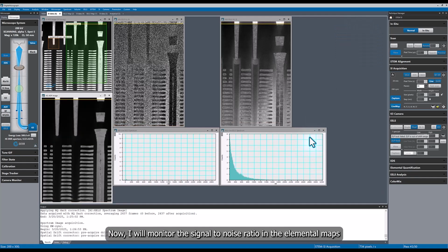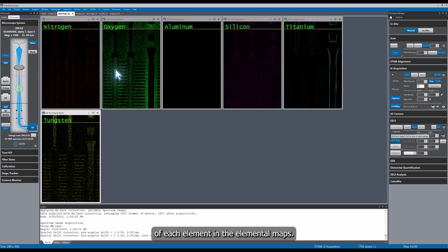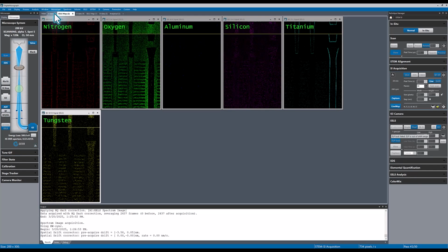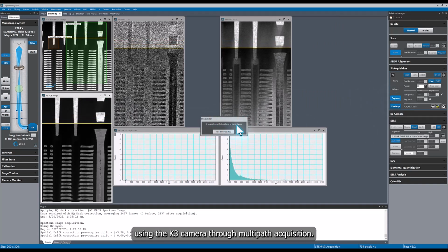Now I will monitor the signal-to-noise ratio in the elemental maps and stop the acquisition once I observe a high enough contrast to see the distribution of each element in the elemental maps. This concludes the lesson on acquiring a spectrum image using the K3 camera through multi-pass acquisition.